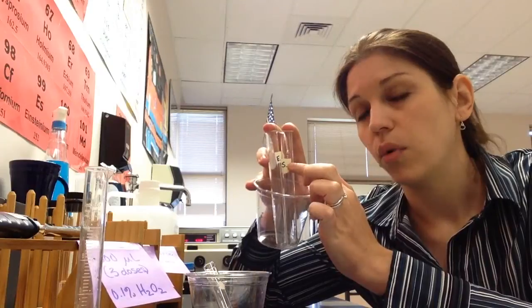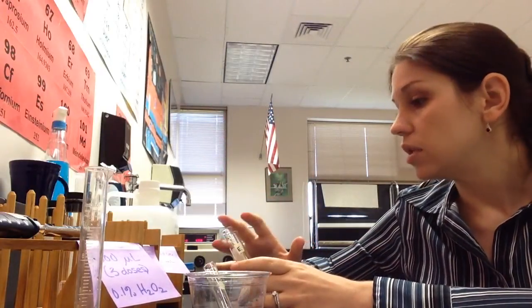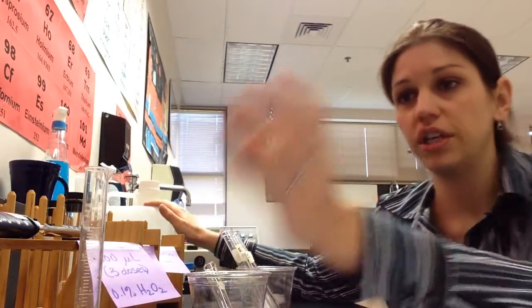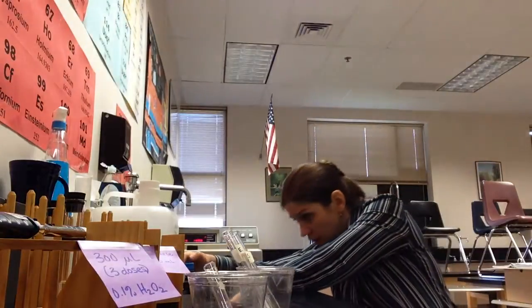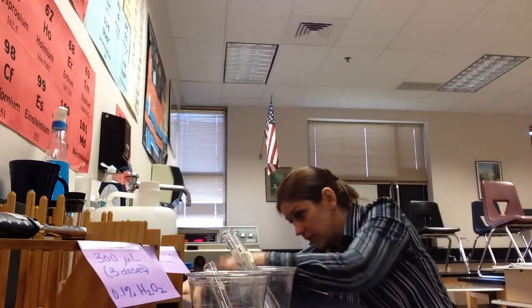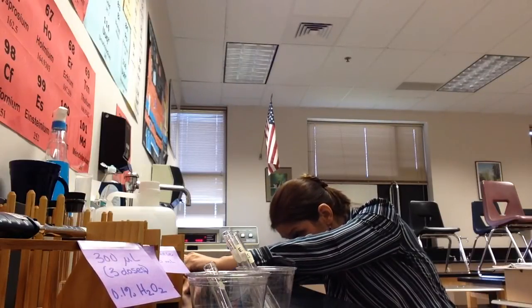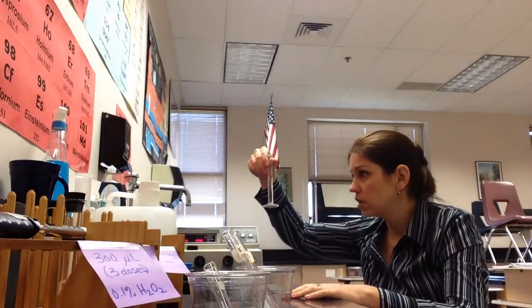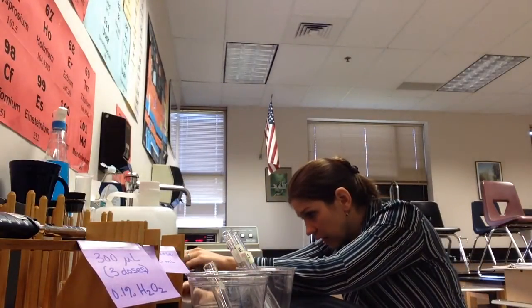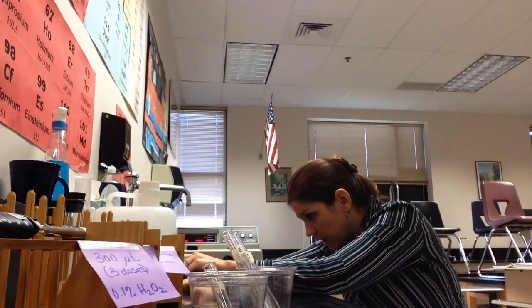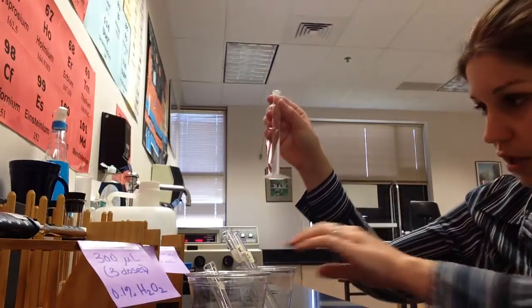What's important is that you use DI water for this. Don't use tap water. It will mess with your results. And so we want to make sure that we use our jug. So to measure our water, you're just going to use your graduated cylinder. And so I'm going to start by filling my substrate test tube with seven mils. And you do need to be fairly precise with this very often. As you guys know, I tell you that you don't need to be precise in biology, but this is one of those times when you need to do it properly. And so right on down to the last drop, if you want to get a dropper, in order to make sure that you do it properly, you can. I've got seven mils, that's going to go in my substrate tube.